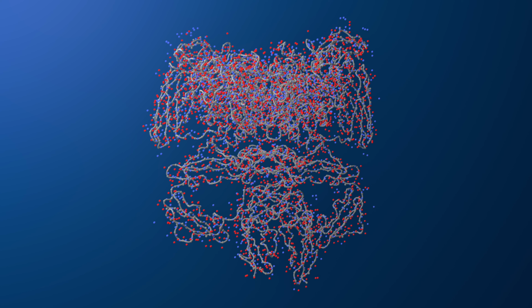Finally, the tool constructs a complete atomic model using Pulchra and Rosetta CM to refine the structure. These models are scored using both DAQ and DOT scores, which measure local quality and fit to the Cryo-EM map. Now let's walk through how to use DeepMainmast on the Kihara Lab EM server.